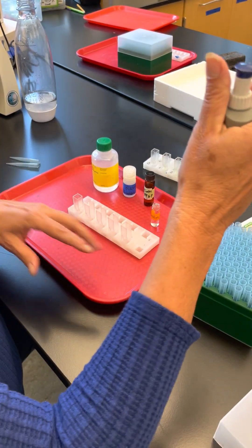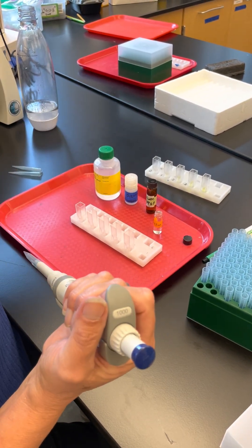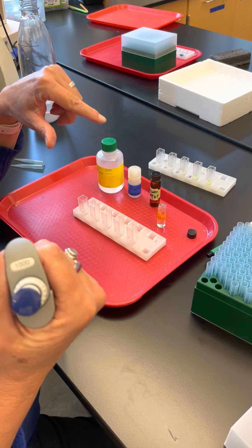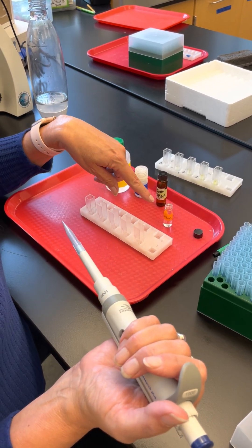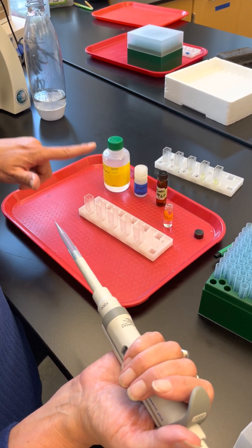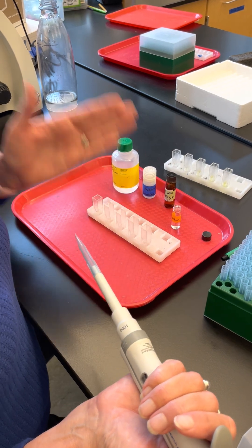Change tips and add one milliliter of enzyme. As soon as you add the enzyme, start the timer. Cap it and mix it. Then every minute, take half a milliliter out and place it in the next cuvette — so each cuvette represents one minute, two minutes, three minutes, four minutes, five minutes.